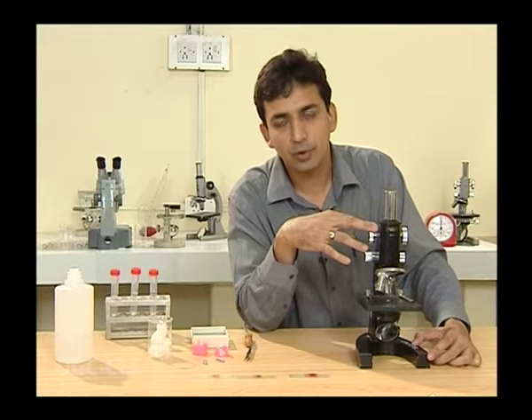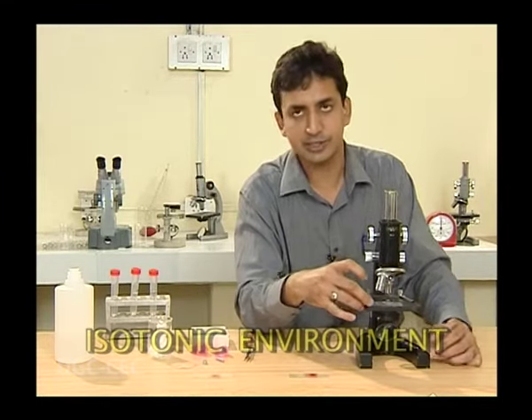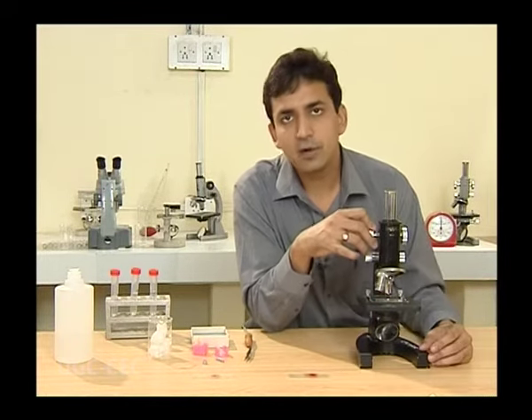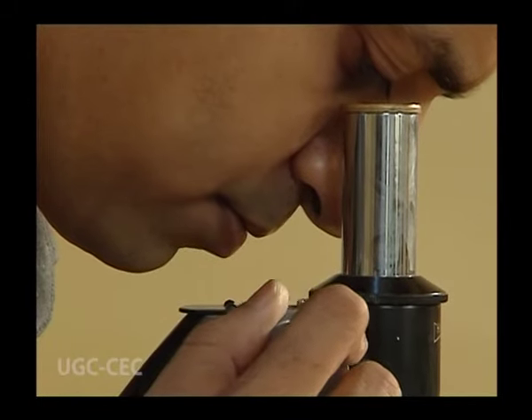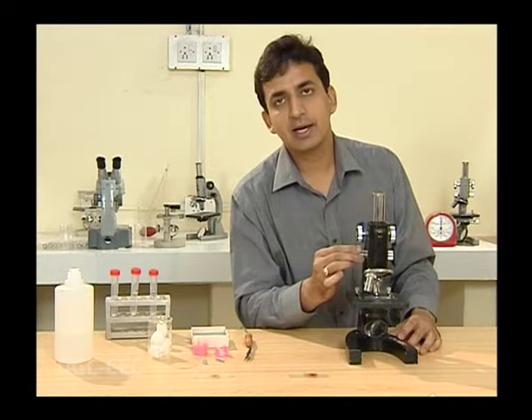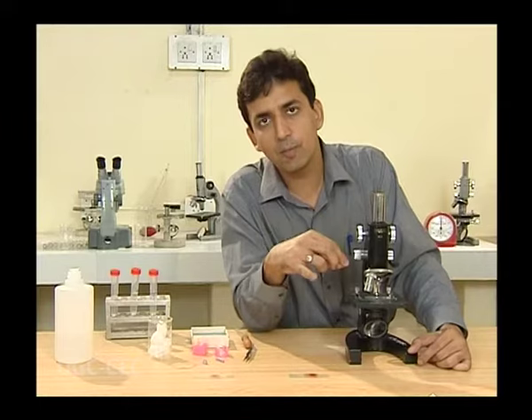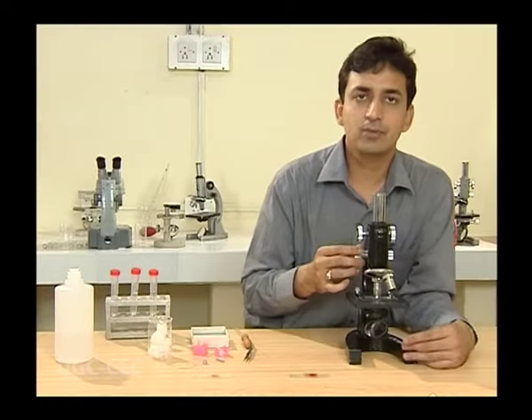Now observe the slides under the compound microscope. Take the slide with the isotonic environment and place it on the stage. Fix the slide using the stage clips. First adjust the field using the coarse adjustment screw, then fine-tune with the fine adjustment screw. Once adjusted on low power, switch to high power and make your observation.